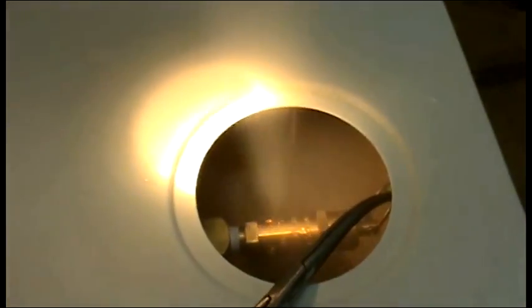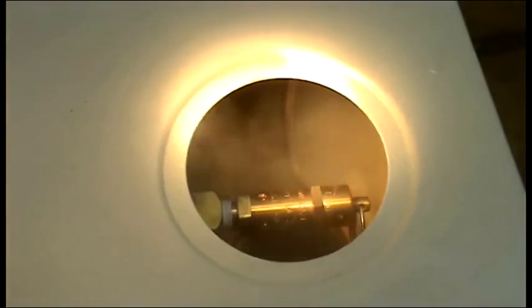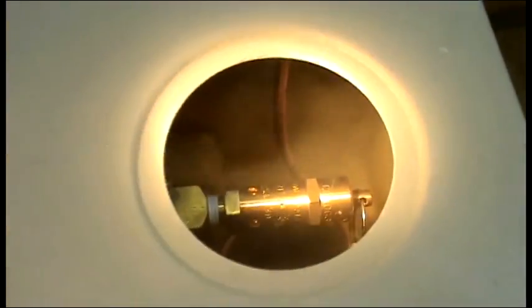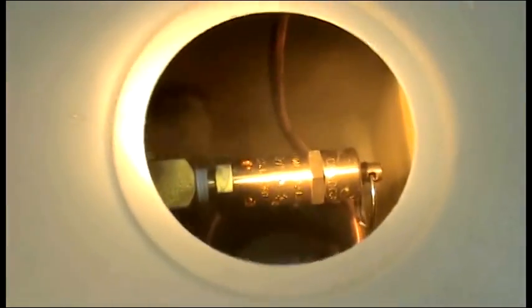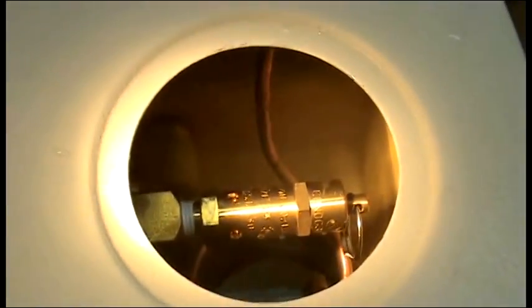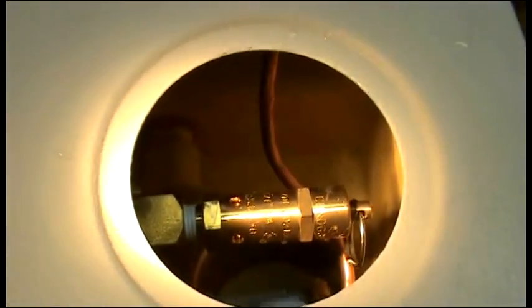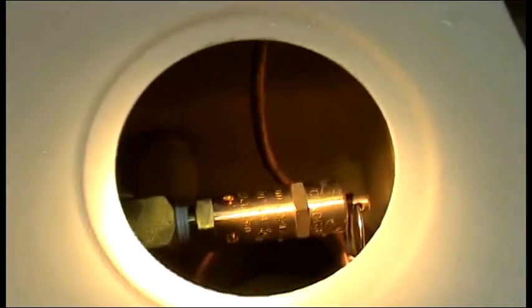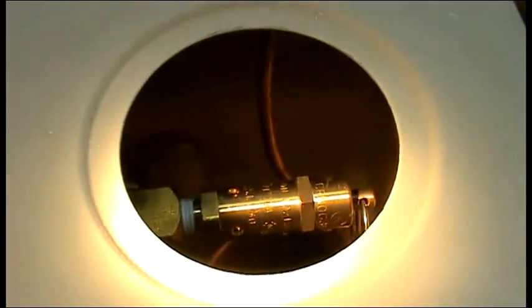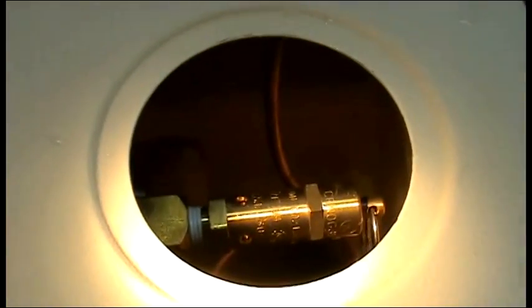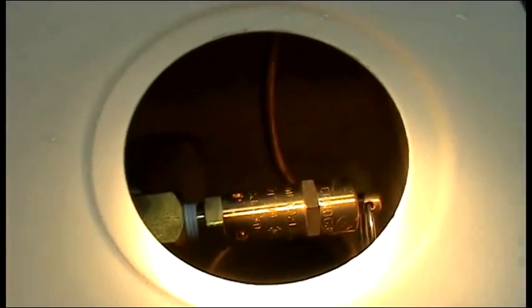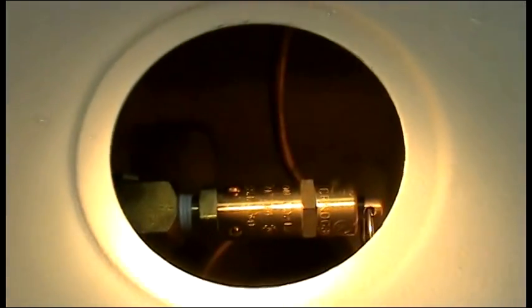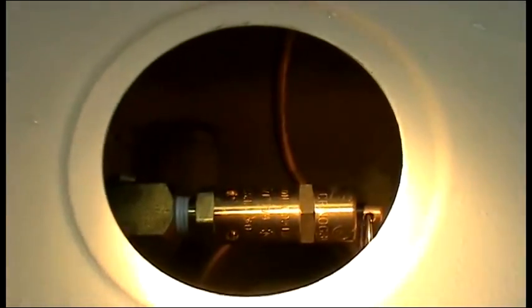Remove the safety cover. You can use the end of a screwdriver or a long implement. Grab the safety ring and pull outwards for at least two seconds. This blows debris out of the safety valve, ensures that this important device is functioning, and keeps your autoclave performing to peak performance for years to come.